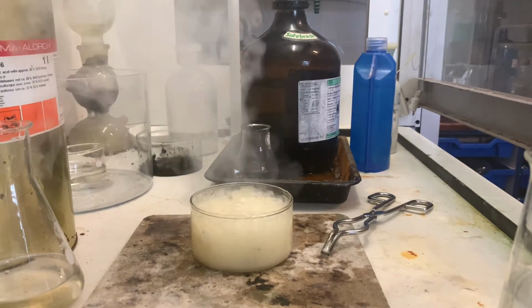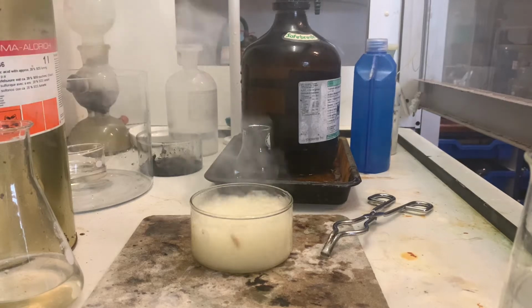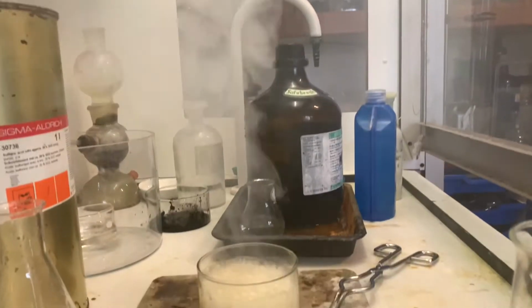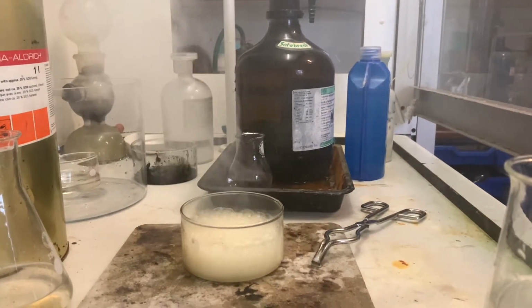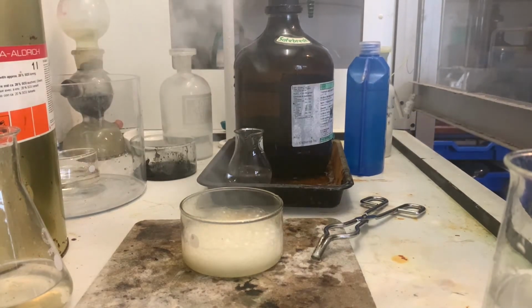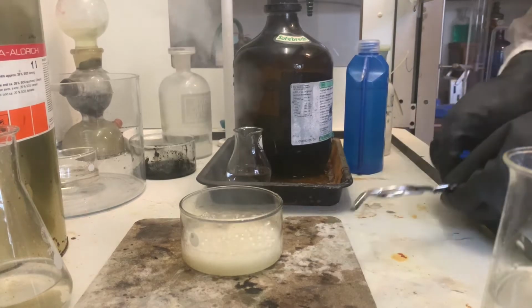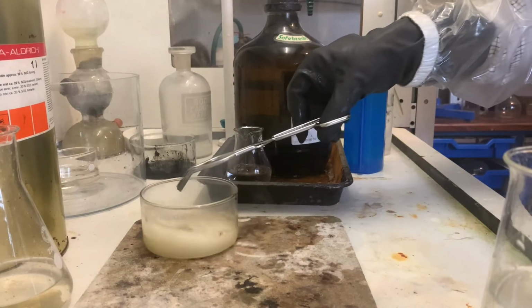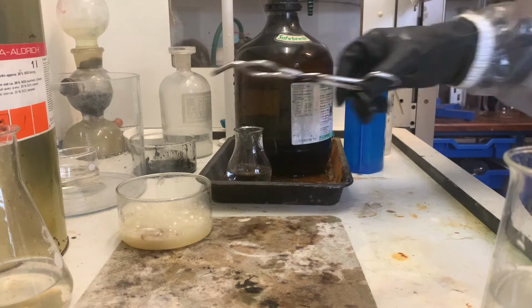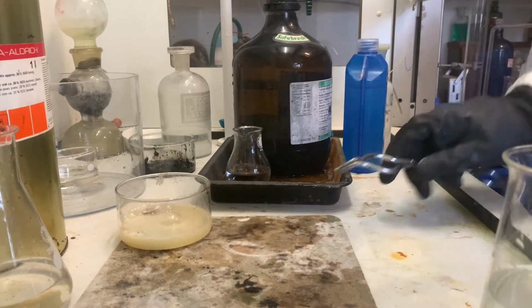And as you can see, if that was your skin or your face or your eye, which is why it's very, very important to use correct PPE, and the fume cupboard is full of sulfur dioxide and steam and carbon dioxide, and there's not going to be very much left to eat after that. Now you'd think that Walter White, with all his chemistry skills, would have known to do that.